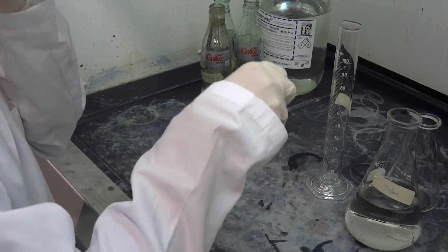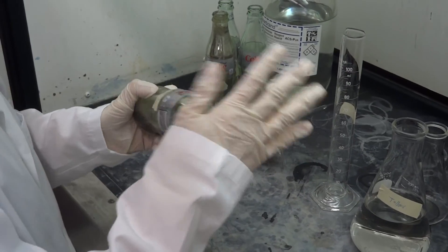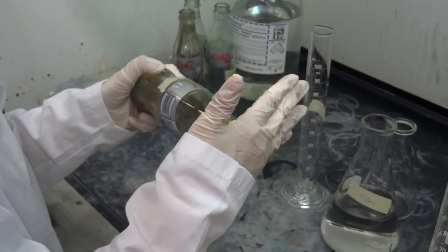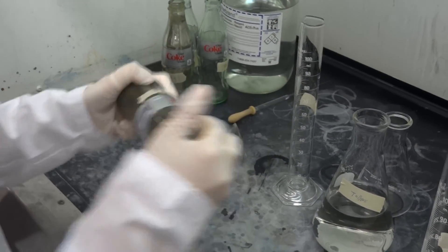So often when this reaction is being performed, sometimes it doesn't look like anything's happening at first because it takes a few minutes. But after a minute or two, you should start seeing a beautiful silver mirror being produced on the inside surface of the bottle.